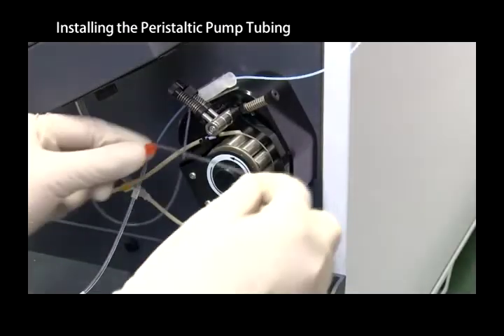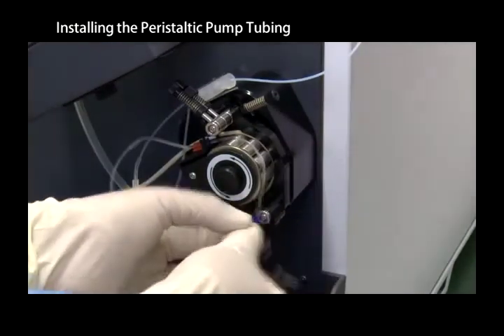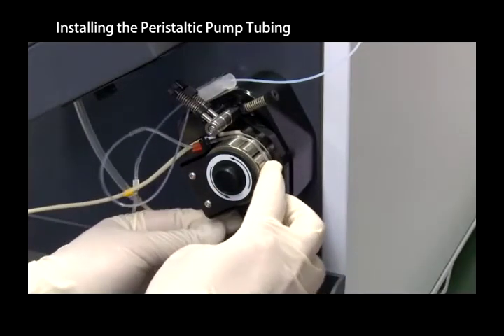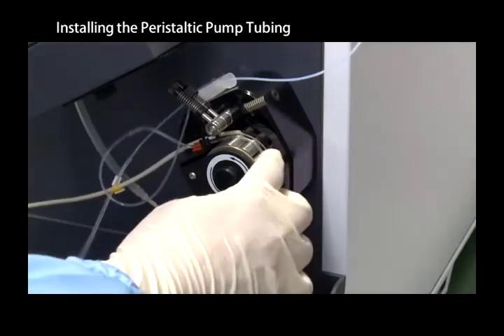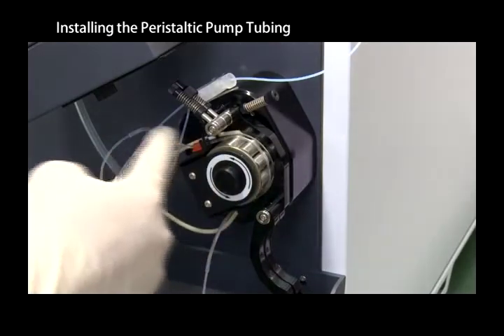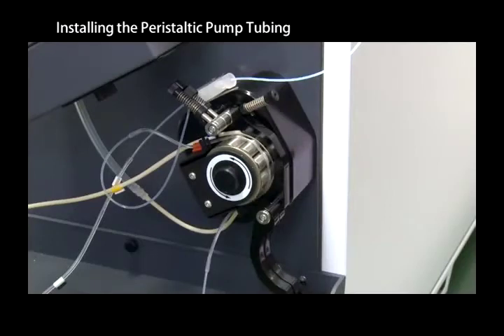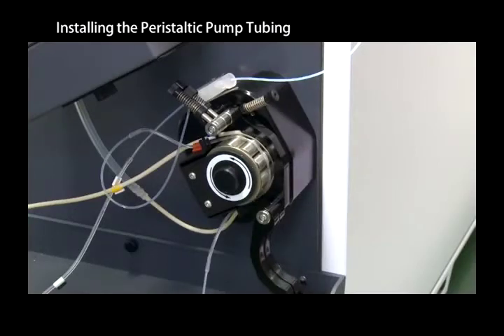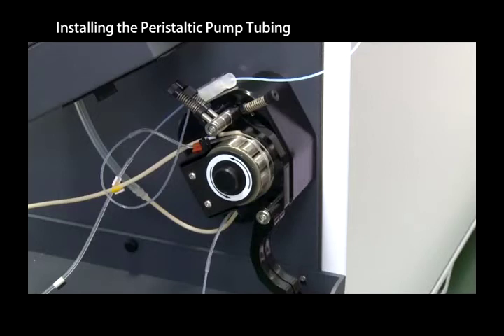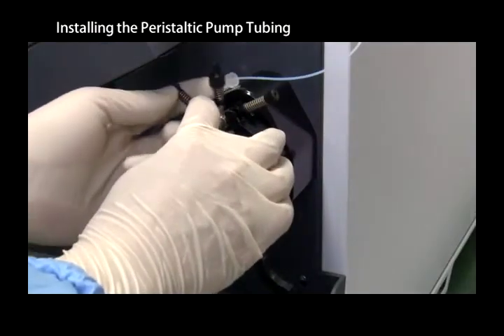Hang the upstream tube stopper over the top of the peristaltic pump. Stretch the tube over the roller and hang the downstream tube stopper underneath the peripump. Recheck the direction of the peripump rotation and make sure the internal standard flows toward the nebulizer. Clamp the tube by dropping the lever.